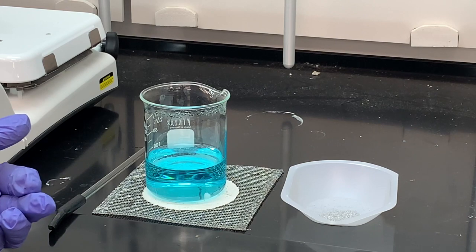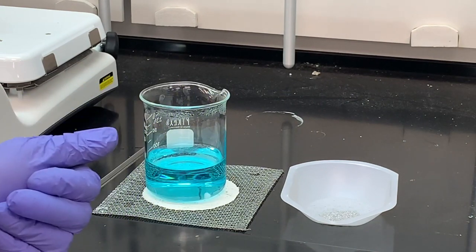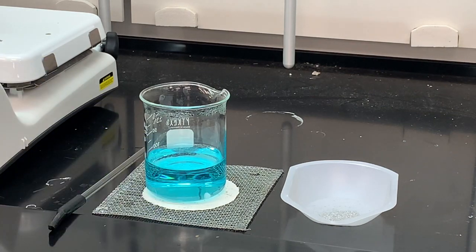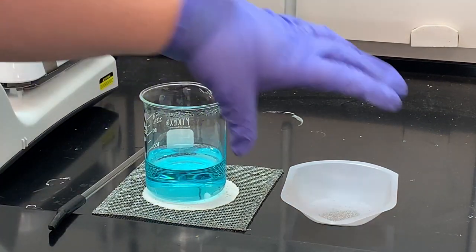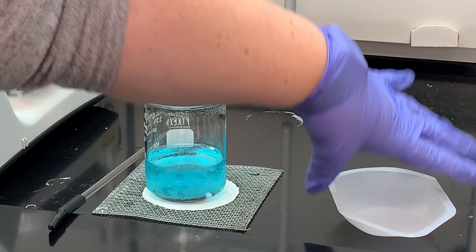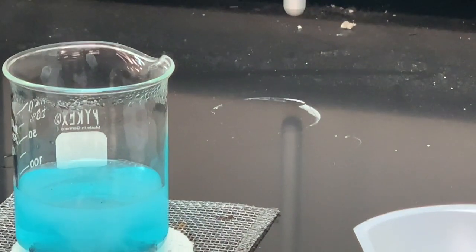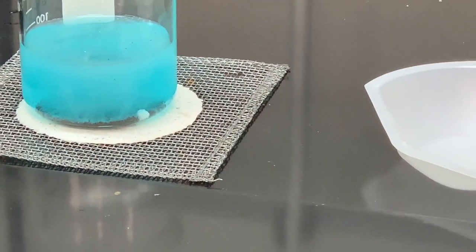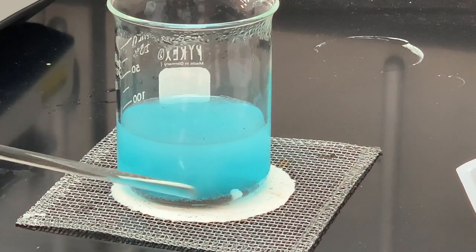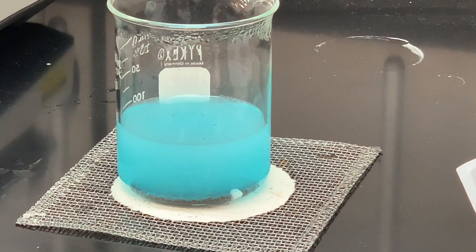The side reaction between sulfuric acid and zinc is the one that produces hydrogen gas. The reaction between copper sulfate and zinc will produce copper. We started with copper, went through several different reactions, and now we get back to copper. So I'm going to add the zinc and stir that up. In my solution I have bubbles — pretty fine bubbles — and that is the hydrogen gas. If you look at the bottom of the beaker, it's turning brown; that is the copper forming. I'm going to stir this until the reaction subsides.